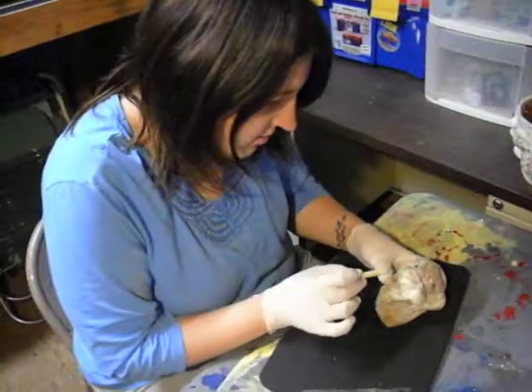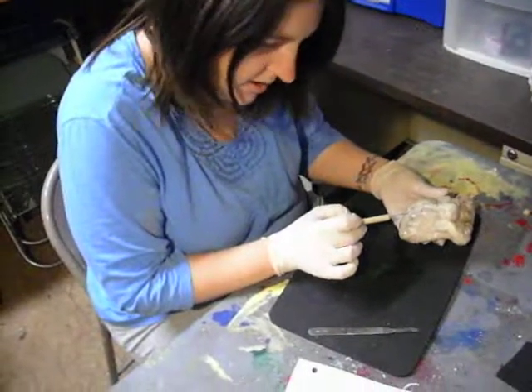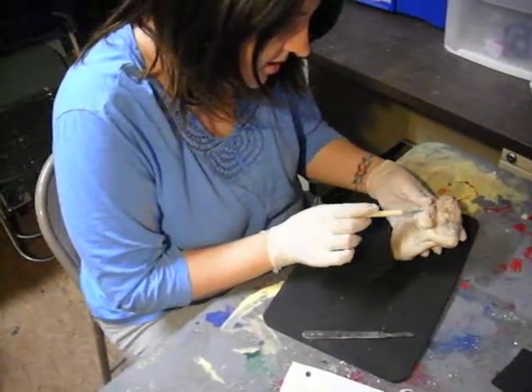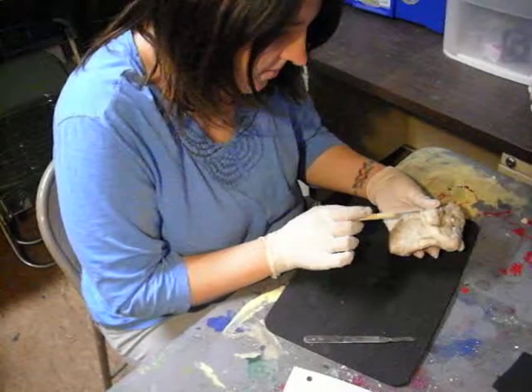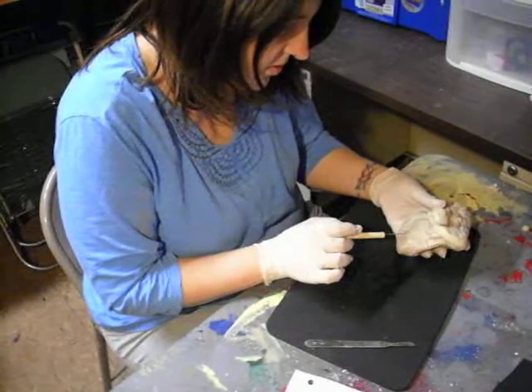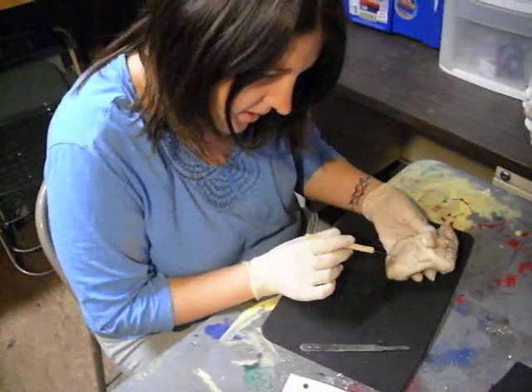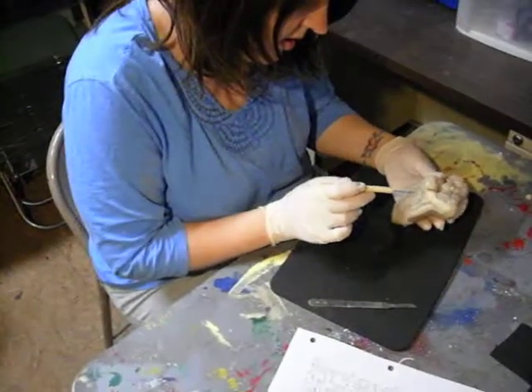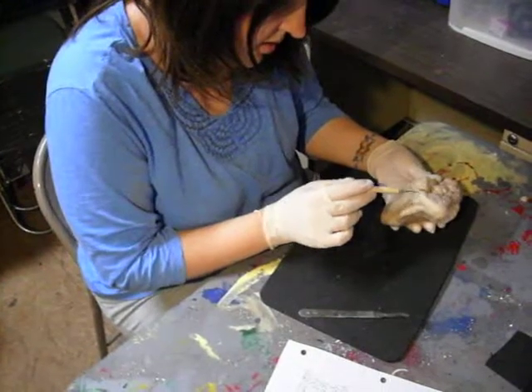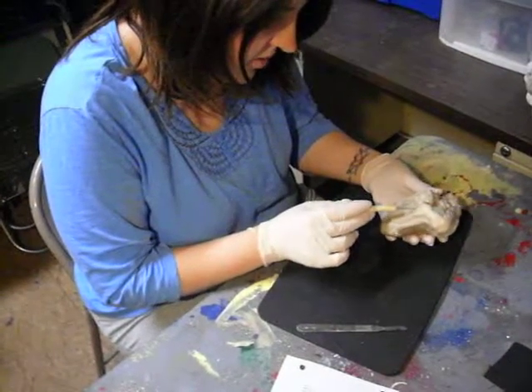This is the right coronary artery, it's right here. This is the right atrium. This is the right ventricle. This is the aorta in here. The pericardium. The pulmonary trunk.